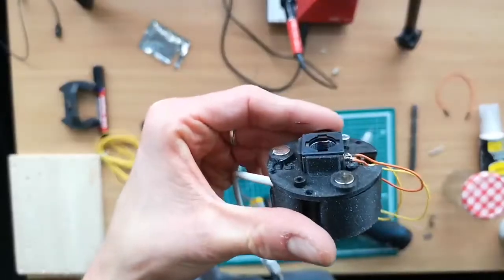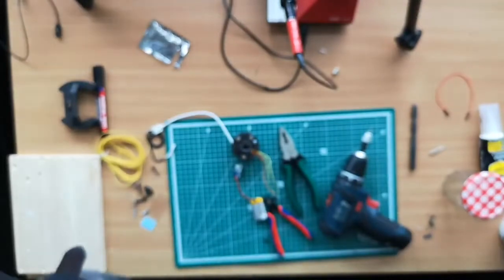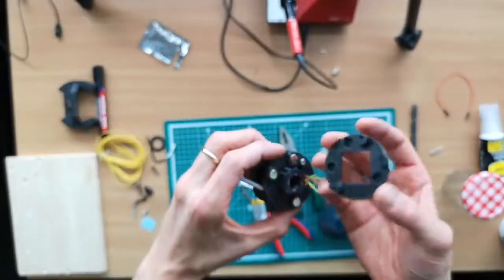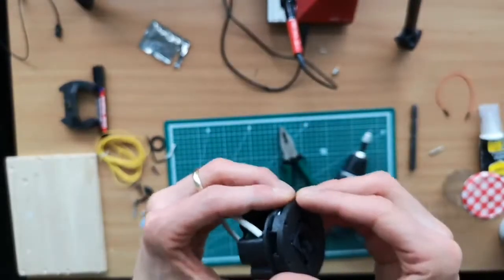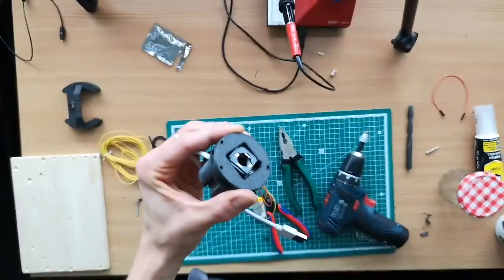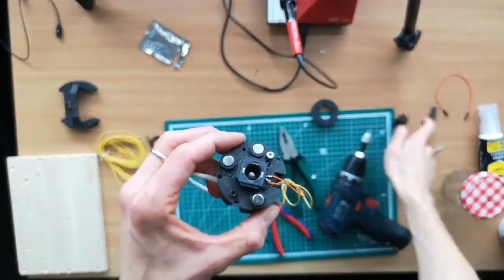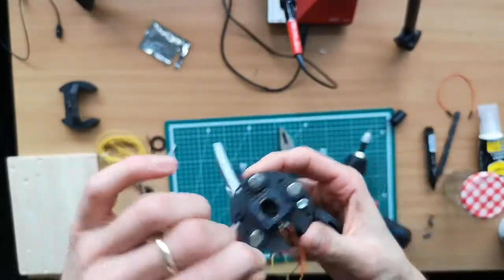So now everything is put in there correctly. And then the stage bit is moving in the way that you have the counterpart. You have 3 holes for the magnets, and they are essentially just pressing away or getting pressed away from the magnetic forces. So you have to make sure that this hole matches that one. And now we have to find the correct orientation. For this I have brought a pen so that you can mark the orientation based on the opposite side. What you do now is start with that one. And so you know now that this here is the direction which should go inside this thing here. So they should point outwards. So we are going to do that now.